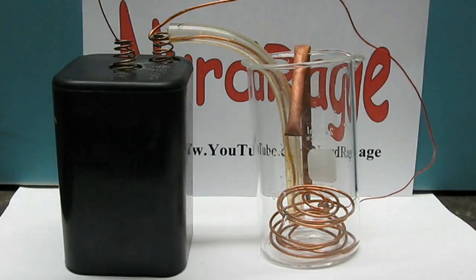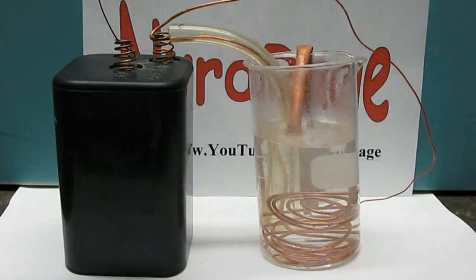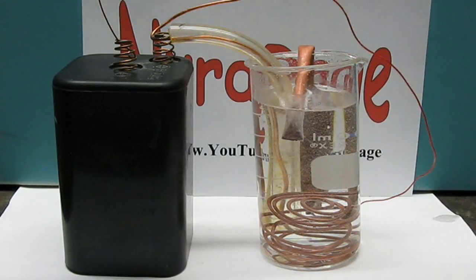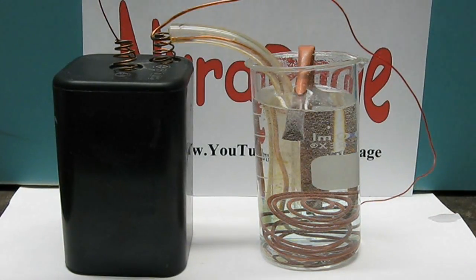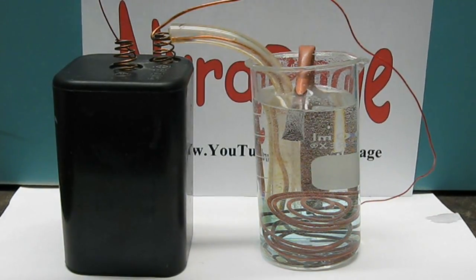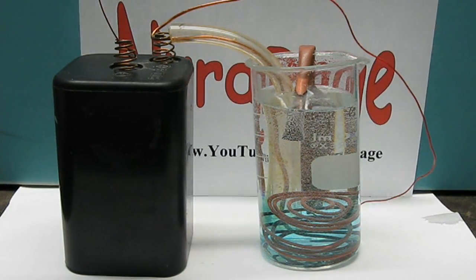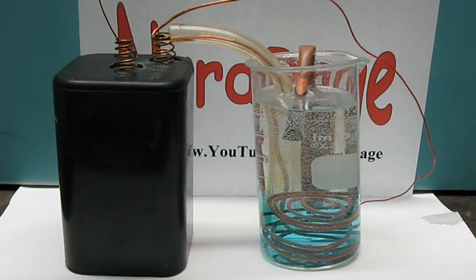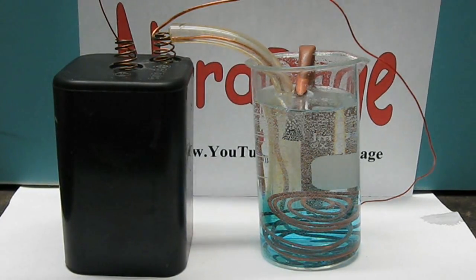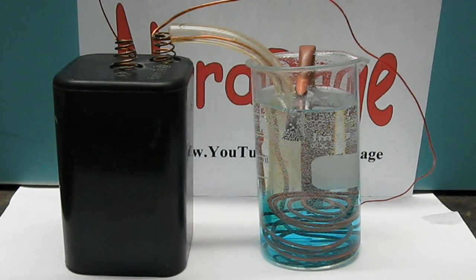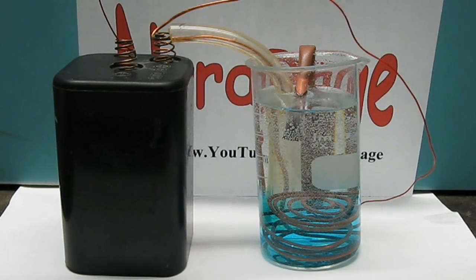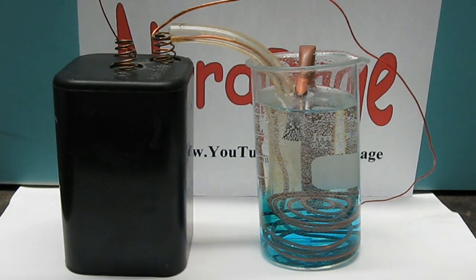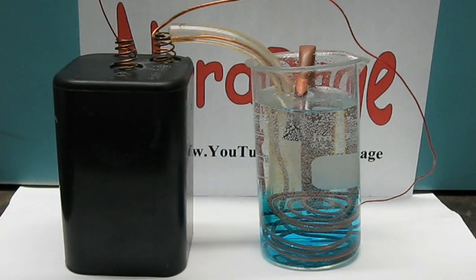Connect it up to the battery and fill the cell with dilute sulfuric acid solution. You only want the negative electrode to bubble for best efficiency. If both electrodes bubble then you'll need to lower the voltage or raise the top electrode even higher until the bottom electrode stops bubbling. As it runs most of the copper sulfate generated stays near the positive electrode. By preventing the copper sulfate from reaching the negative electrode the conversion efficiency is increased. That's the trick for making copper sulfate by home electrochemistry.